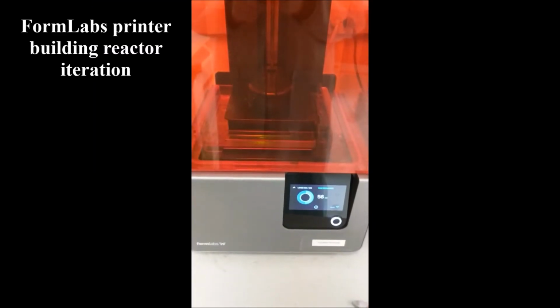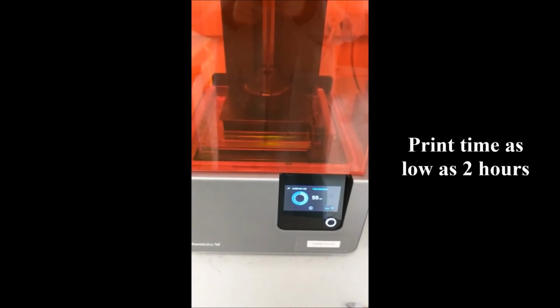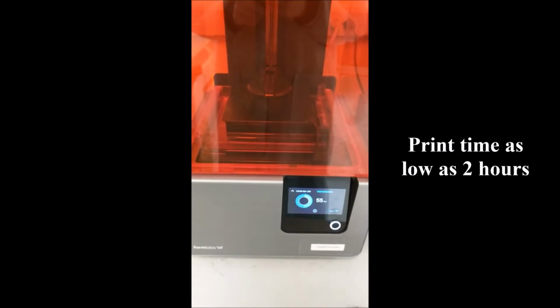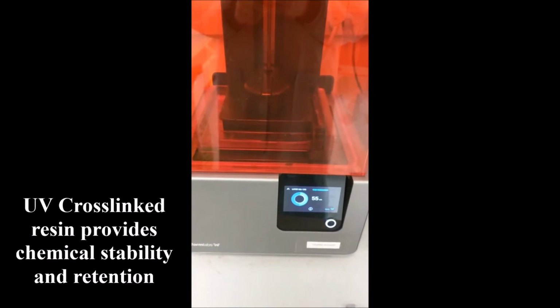Desktop 3D printing resolves the high capital cost problems using cheap material and fully automated assembly. Rather than needing to contract a new reactor construction for each iteration, these printers can construct reactors in a matter of hours to the precision of the engineer's CAD model. Formlabs stereolithography printers generate the watertight cross-linked reactors necessary for liquid reactors.